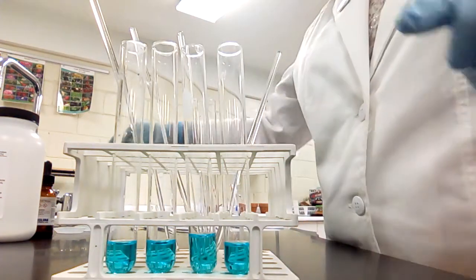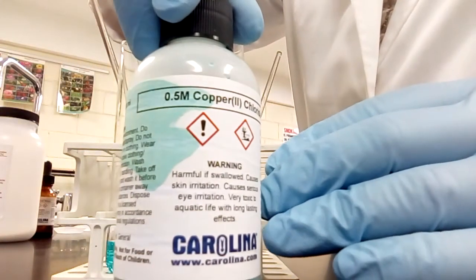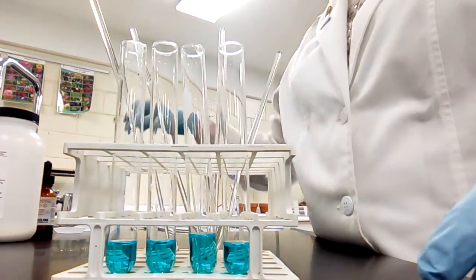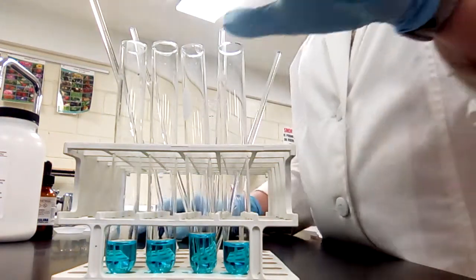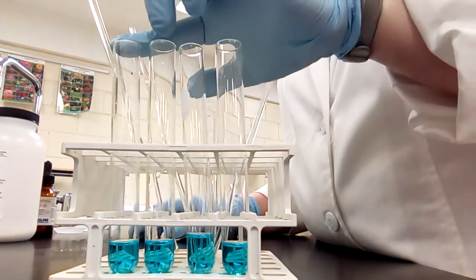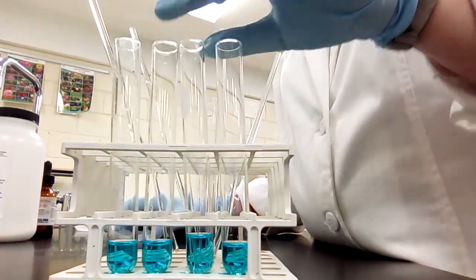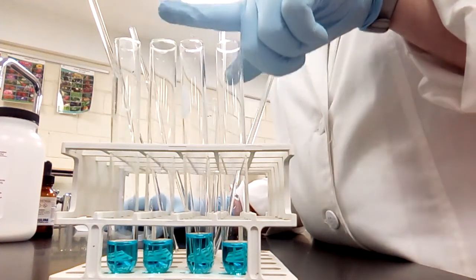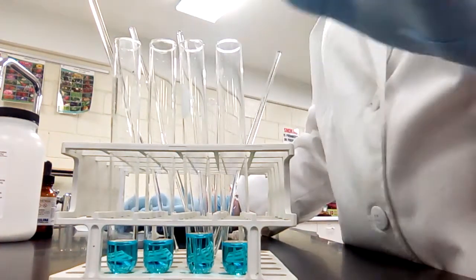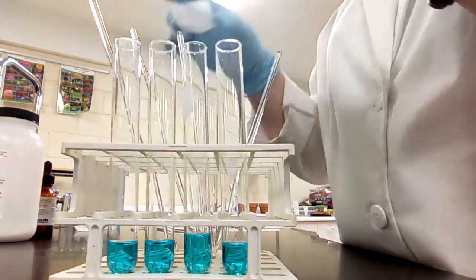So what's in my little test tubes here is copper chloride. That's actually all that's in here right now. And I'm going to leave one of these, the first one, as a blank so you can compare the color and see how the color changes. And in the first one, I'm going to put a little bit of a salt solution. This is sodium chloride. And that's your common ion. It's not just chloride, but because there is chloride in there, and it's going to dissolve, it's like I'm adding that chloride ion to it.